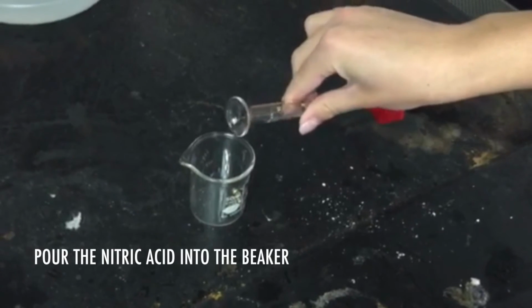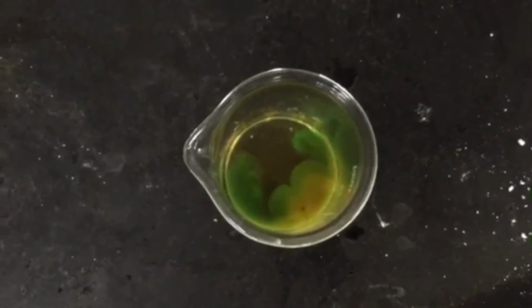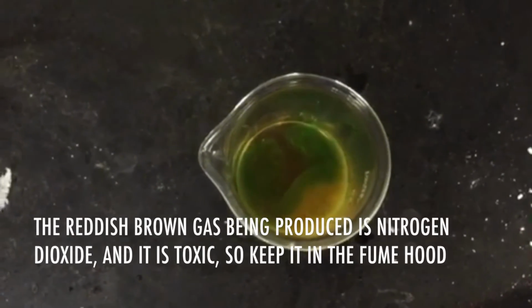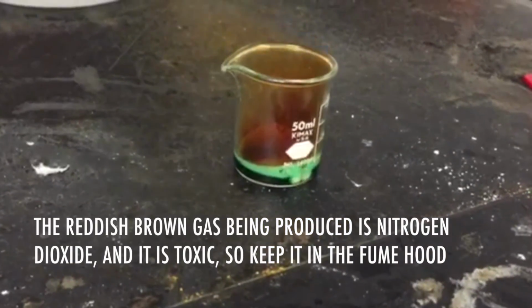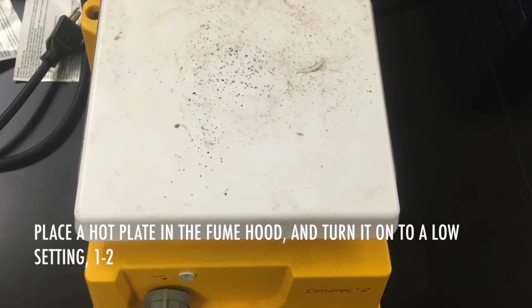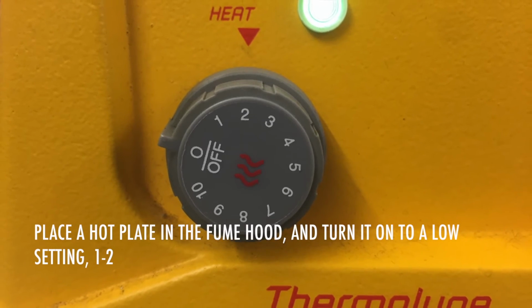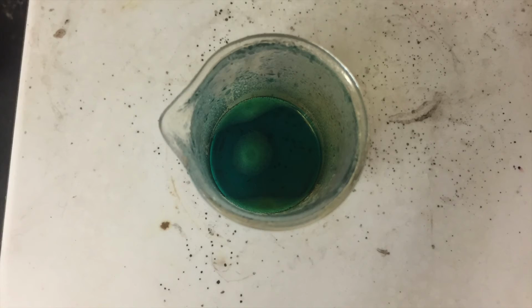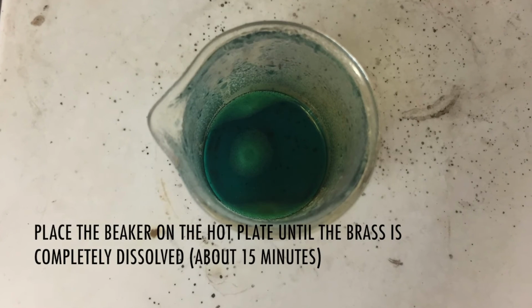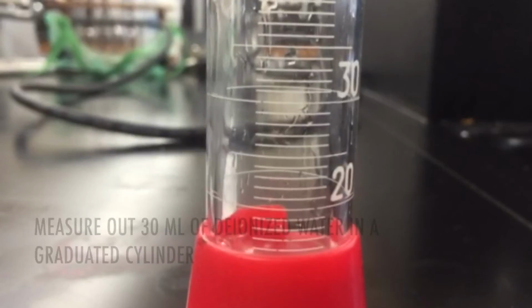Pour the nitric acid into the beaker. The reddish-brown gas being produced is nitrogen dioxide, and it is toxic. Place a hot plate in the fume hood and turn it on to a low setting, 1 to 2. Place the beaker on the hot plate until the brass is completely dissolved, 15 minutes.